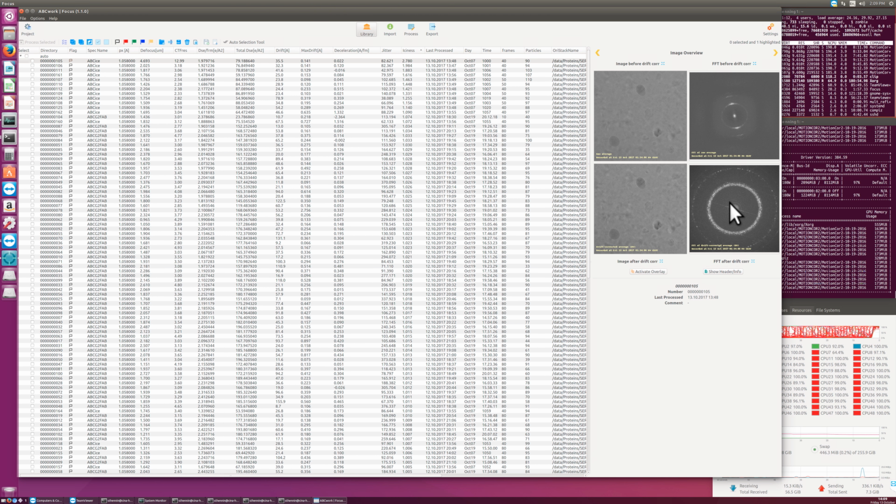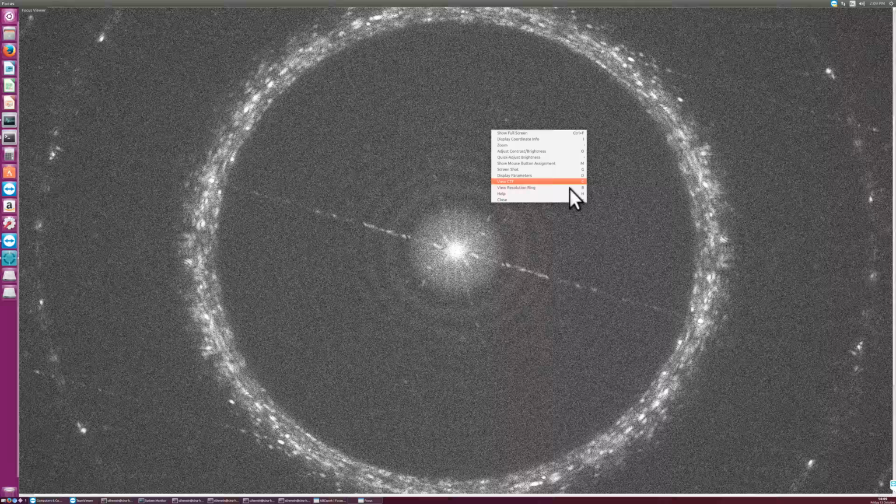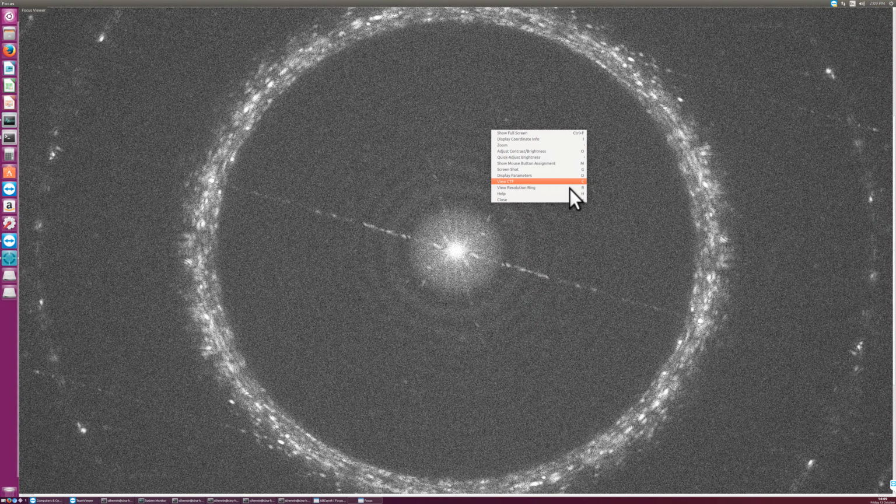So if I go into this Fourier transform by double-clicking this here, I open the Fourier transform. There we see this ice ring at 3.7 angstroms. This is a Fourier transform of a recorded movie and the 2D average of that after drift correction. So we have Thon rings. I can look at the Thon rings by pressing the button C. I can do this in a moment. R would show a resolution ring that is absolutely circular, whereas C shows Thon rings with astigmatism, possibly.